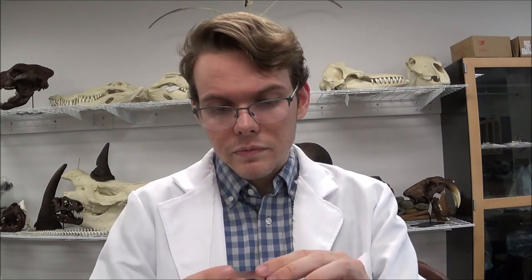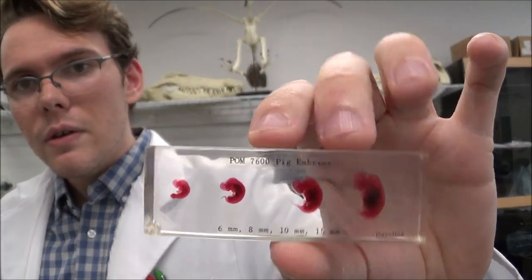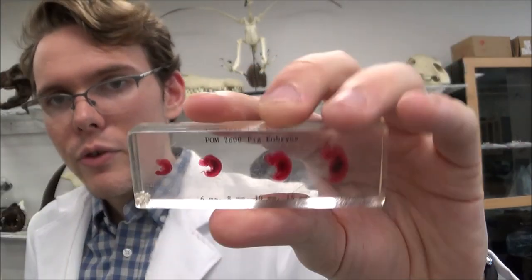Embryonic development is a big area of study in science. And pigs, once again, make a great example for this because their embryonic development follows very similarly to our own. I want to show you up close these stages — we'll show you from this side.